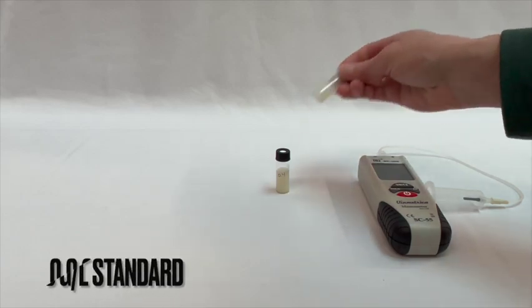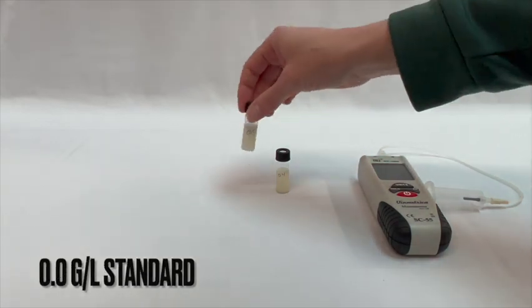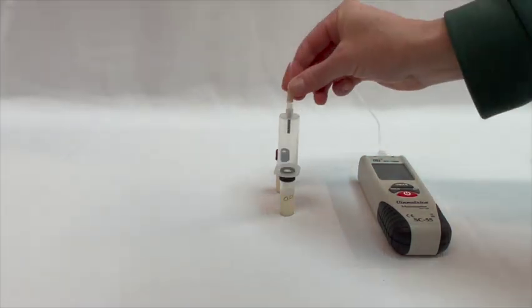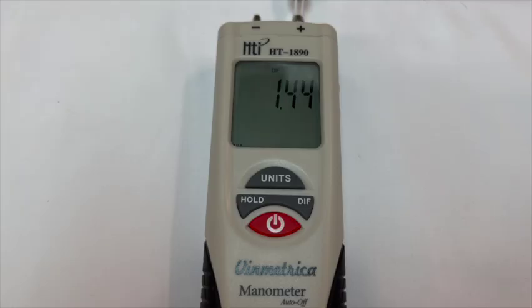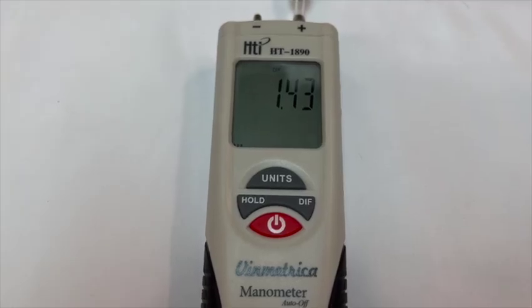If you are running the quantitative mode, you will also test your two standards in the same manner. Shake the vial, take the pressure reading, and record the highest value.